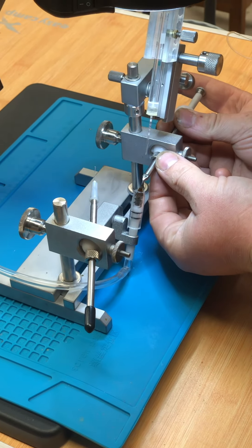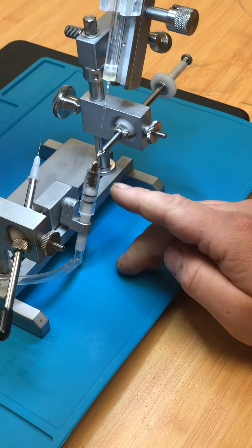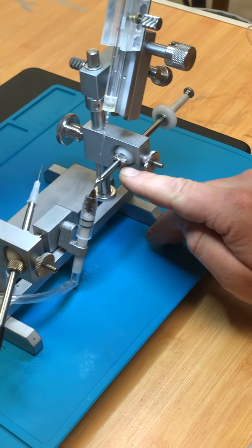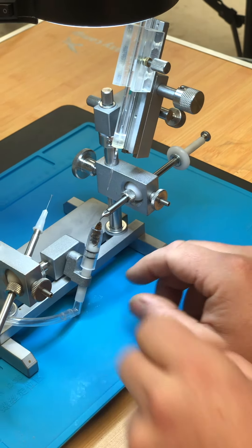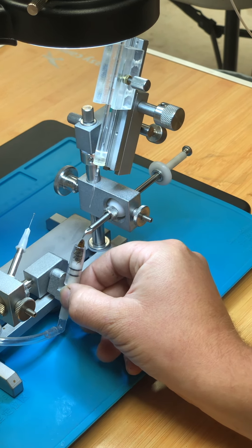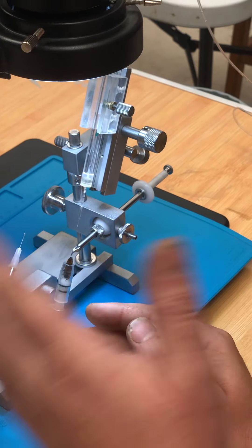When you've got the sting, you can just lift it up slightly. Get hold of it and get the ventral hook out of the way. If you leave the ventral hook there as you lift the queen into position, the ventral hook's going to catch on her and you're going to rip her open. So you don't need it — it's a supportive item to help hold her open. You're now going to manoeuvre the queen into position, so the ventral hook wants to be well out of the way. The queen holder is just to support her abdomen; the sting hook is to hold her in place; the ventral hook is just to support the ventral side of the abdominal opening.